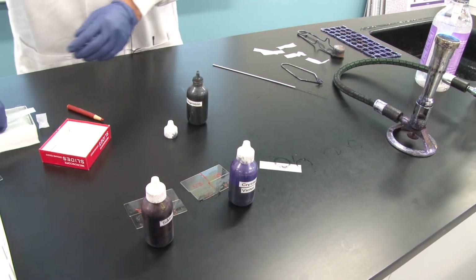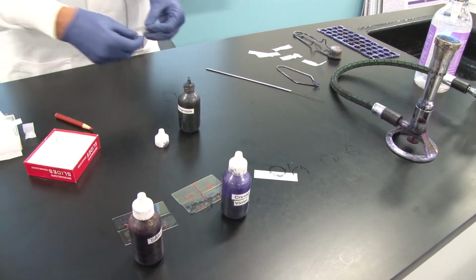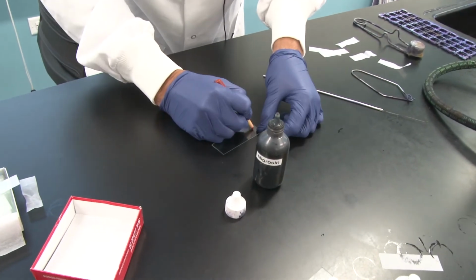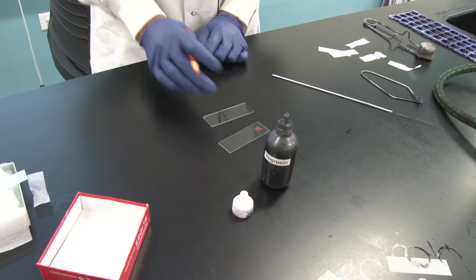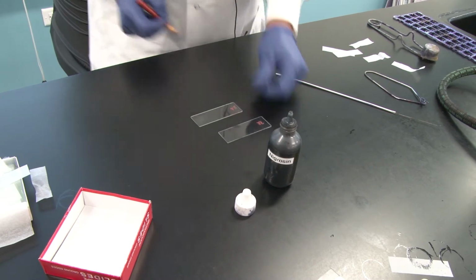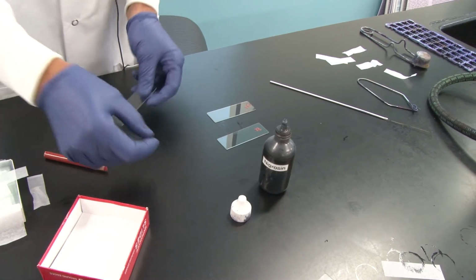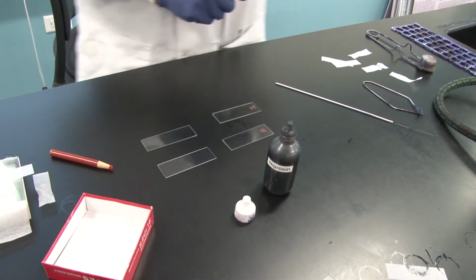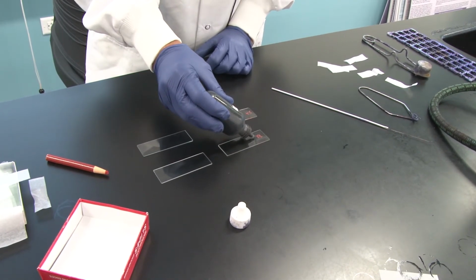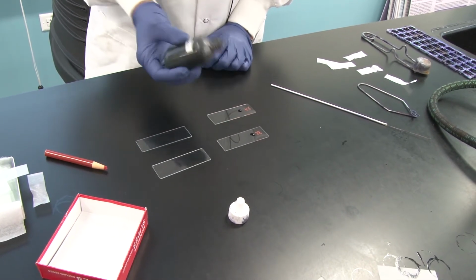and I'm going to show you what we are going to do. The simple negative stain simulates dark field microscopy. I am going to put Rhodospirillum rubrum on one of these slides, and I'm going to put Staphylococcus aureus on the other one. Now, those are the only 2 stocks I'm going to use. I'm going to need 2 additional slides, as you'll see in a moment. I'm going to put about half an inch in from the end a drop of nigrosin on each of these slides.